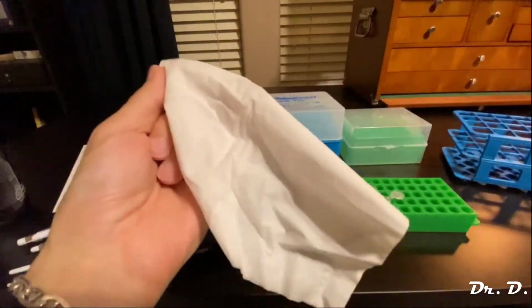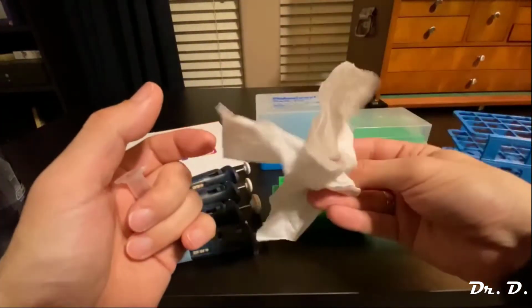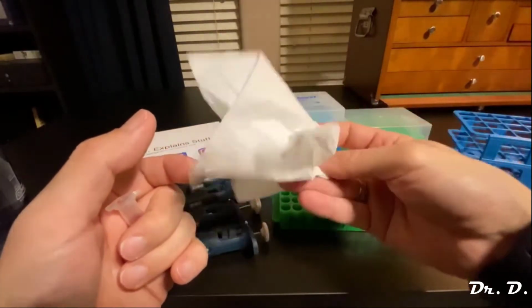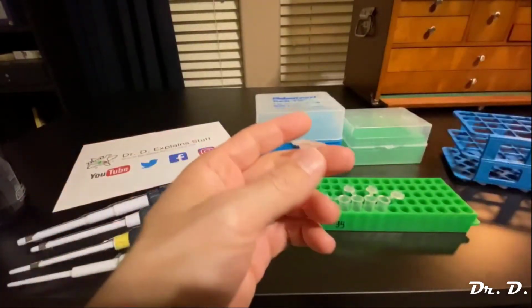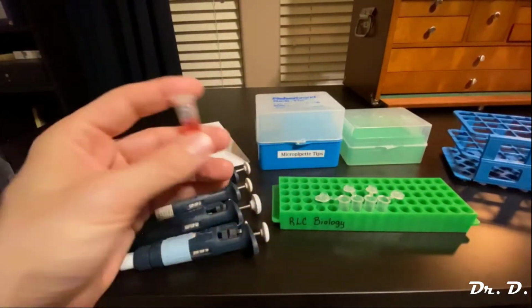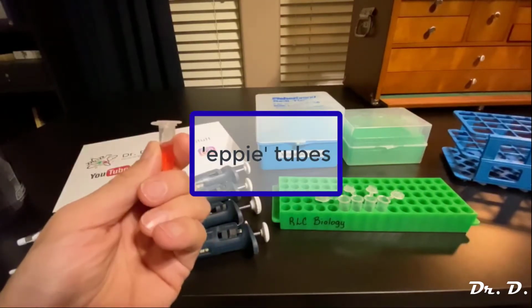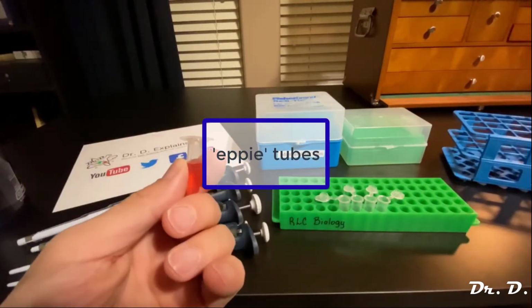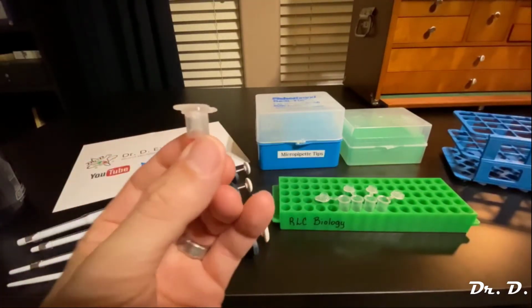Not because this is actually called a Kleenex. It's actually called a facial tissue. But people call it Kleenex because Kleenex is the most common brand of facial tissue. Well, Eppendorf is the company that most commonly makes these tubes, so these are known as Eppendorf tubes or epi tubes, so I'll just call it an epi tube from now on.